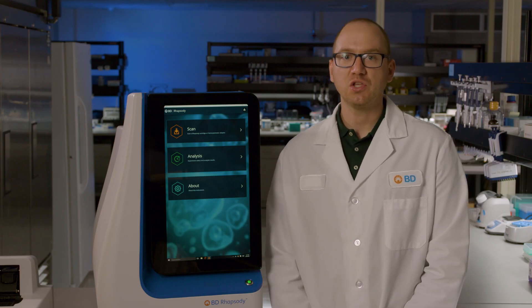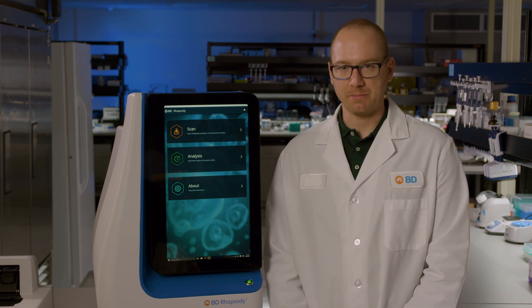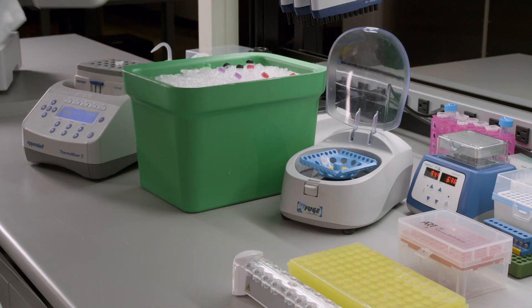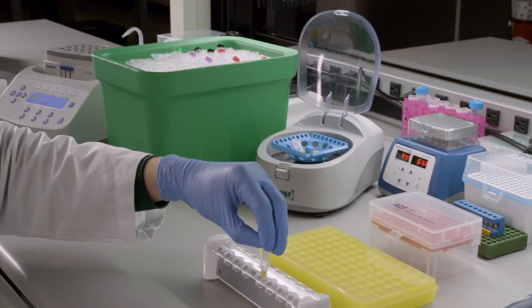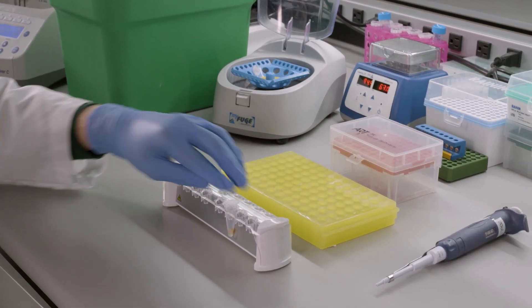If applicable during this time, you may also begin AbSeq and sample tag amplification. After the program on the thermomixer has completed, place the tube with beads on a magnet for two minutes and discard the supernatant.